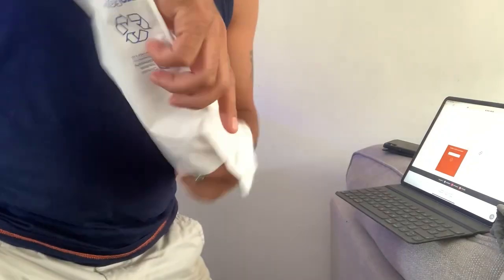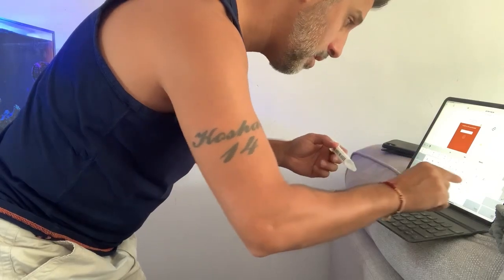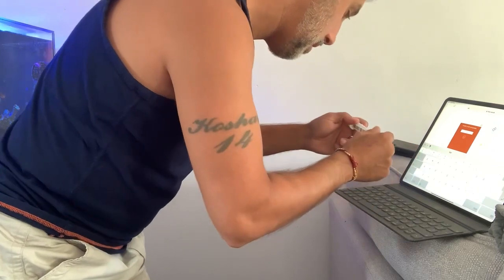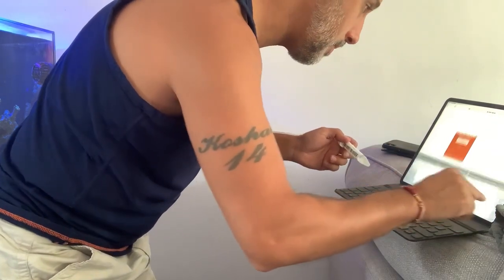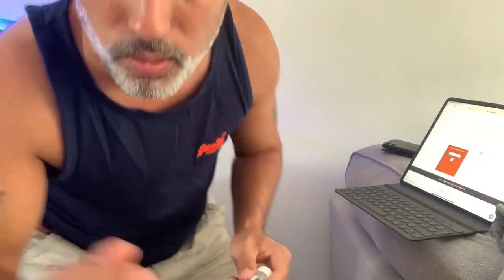To enter the barcode I need to get one of the vials back out. I'll type in the barcode code. It says the barcode has the wrong format, so let me work this one out and I'll be back in a second. Sorry about that — it wasn't accepting it, but it is now, so we've got that saved.